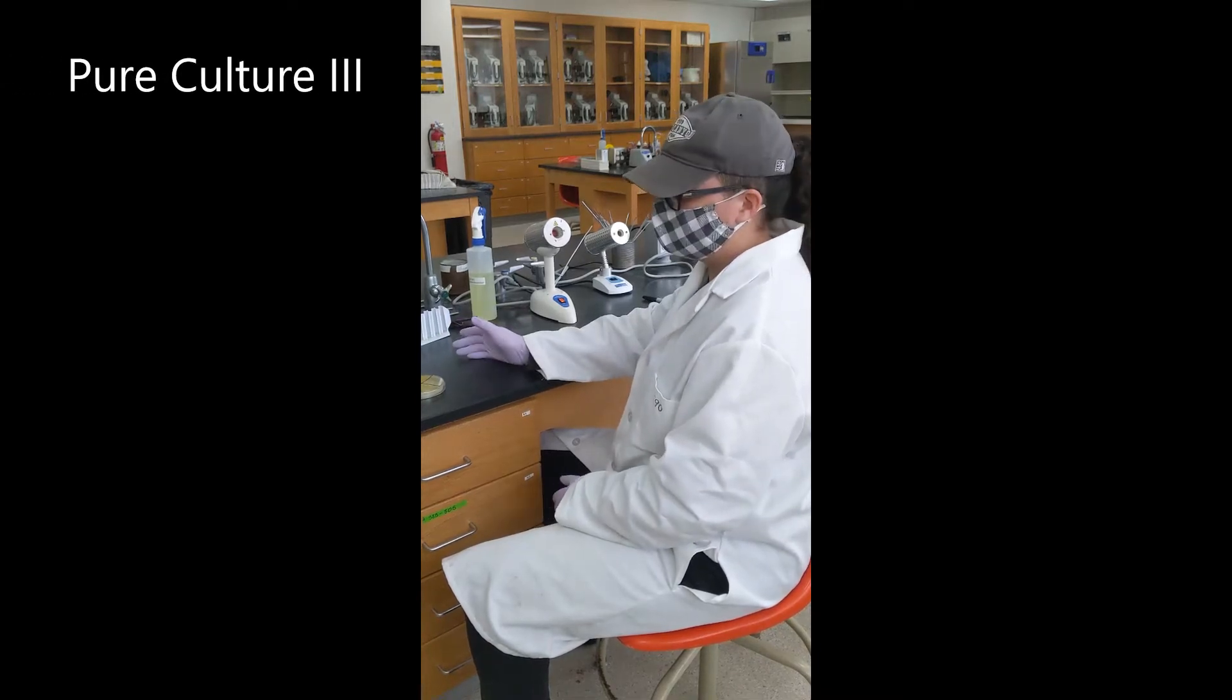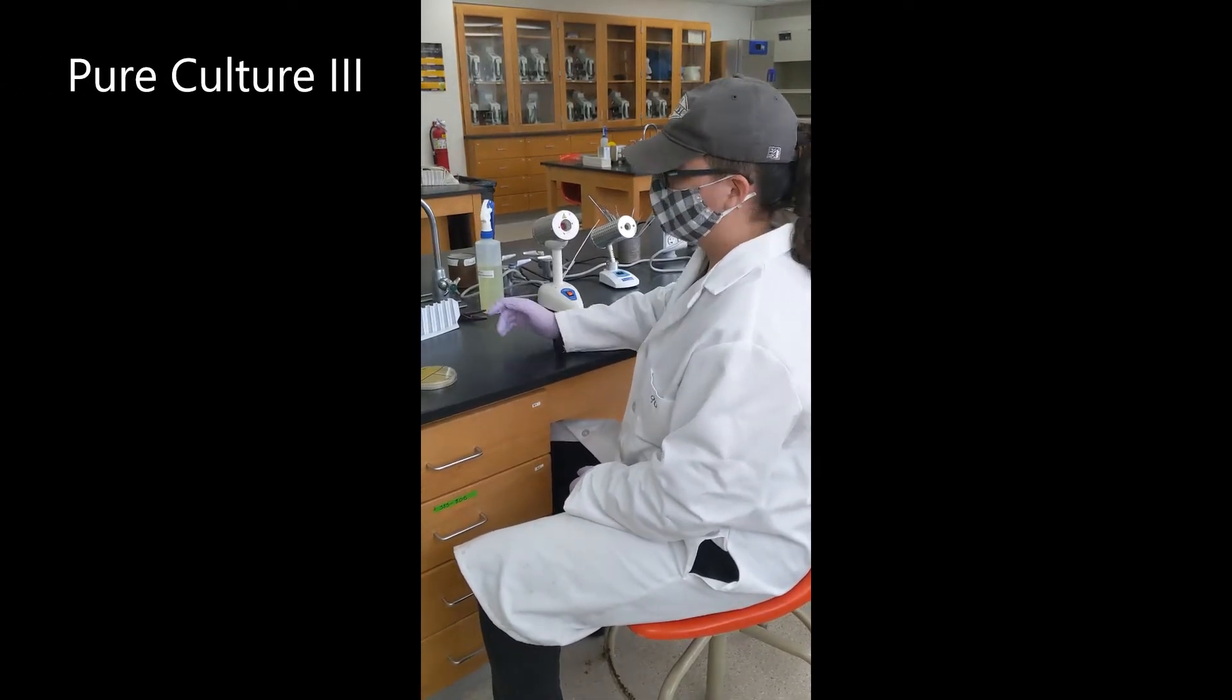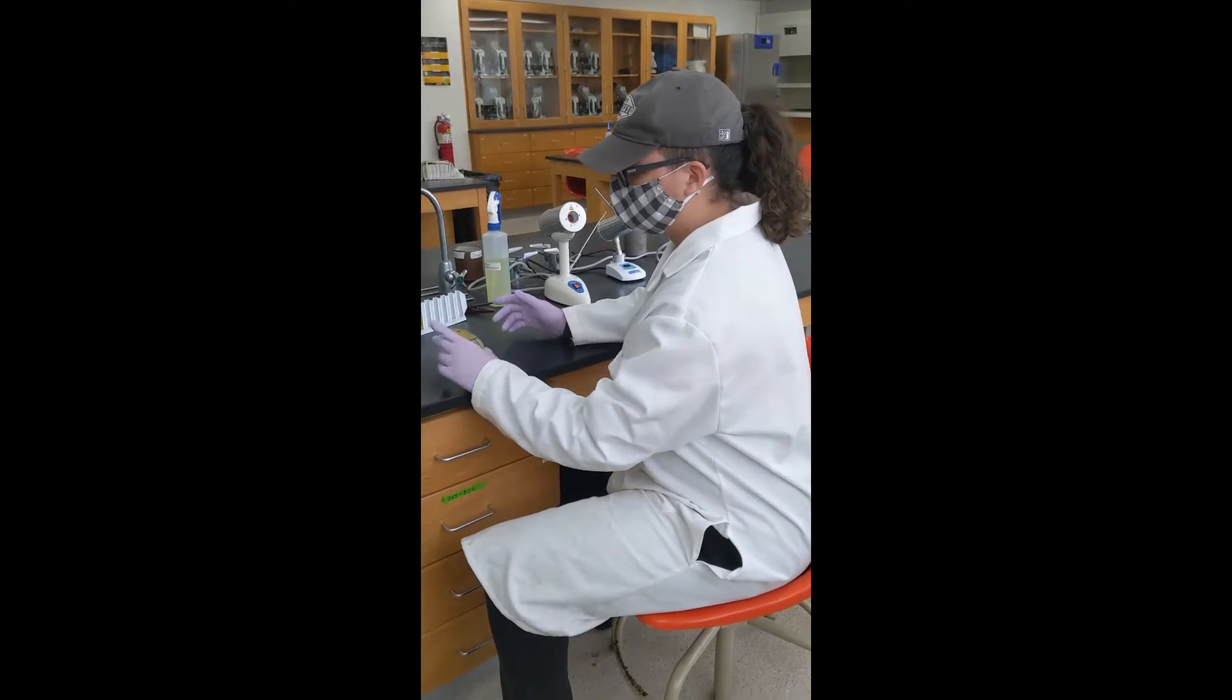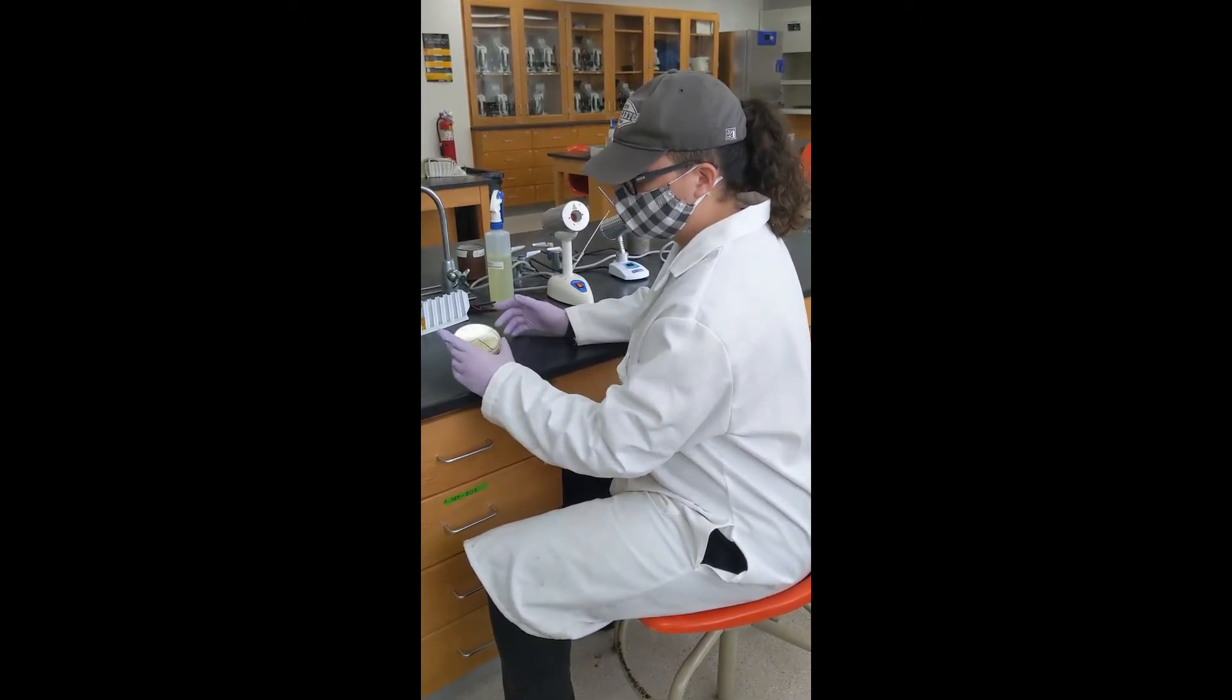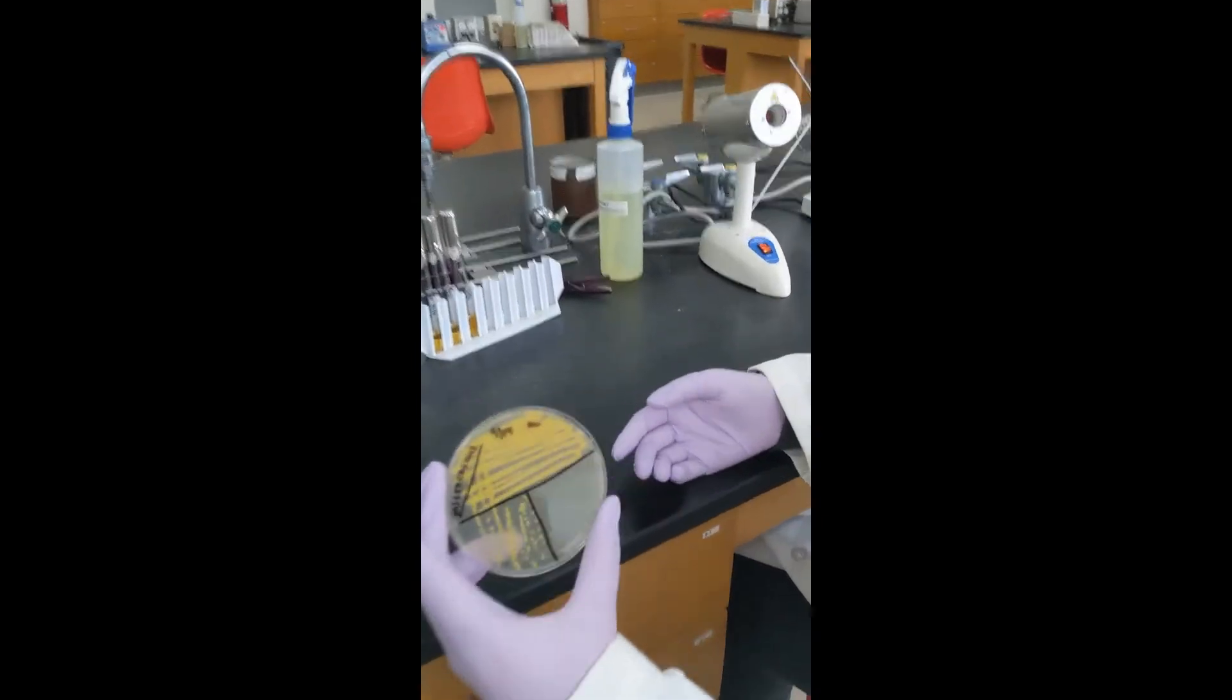Today we are going to be continuing with our pure culture technique. We will be taking the plates that we streaked last time, as you can see here.